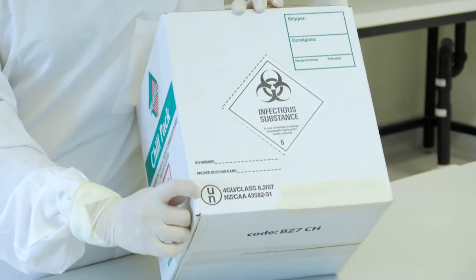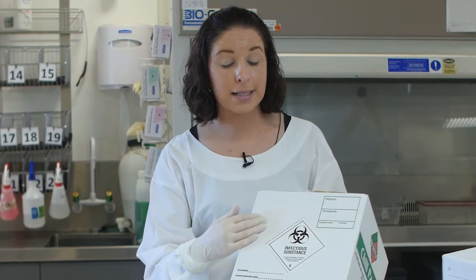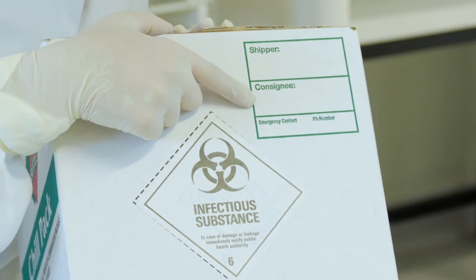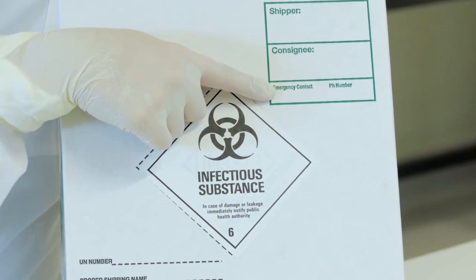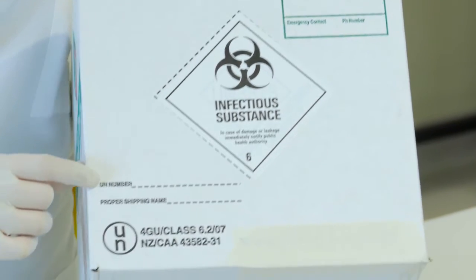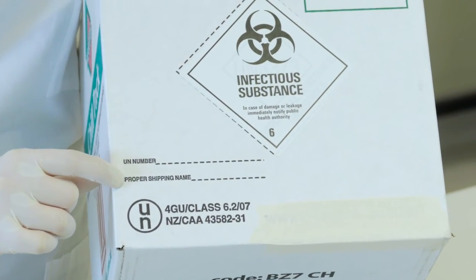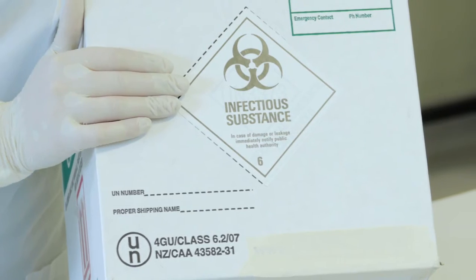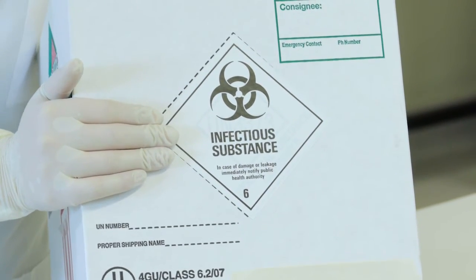Category A boxes must have the UN mark on them and must be purchased from an approved supplier. You'll also need to include the outer markings and labelling on your parcel. These are the shipper and consignee information, a 24-hour emergency contact name and number, the UN number, as well as the proper shipping name. You'll also need to ensure that your infectious substance label is present on the box.